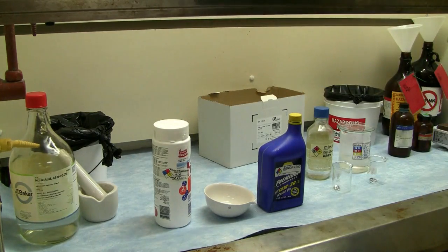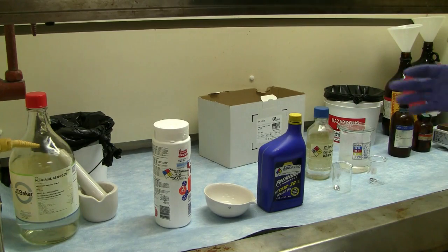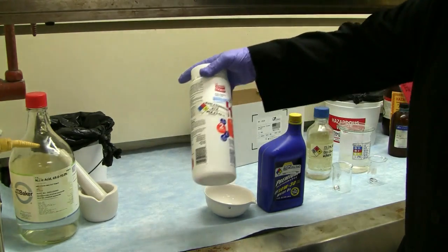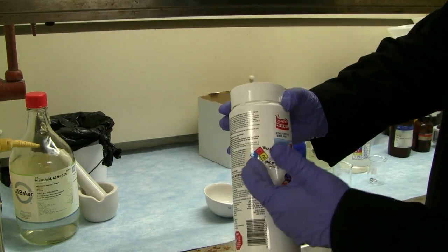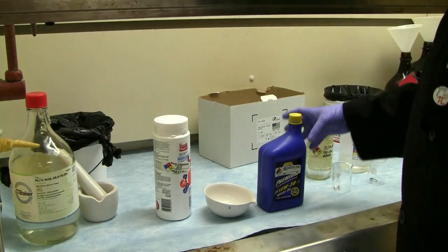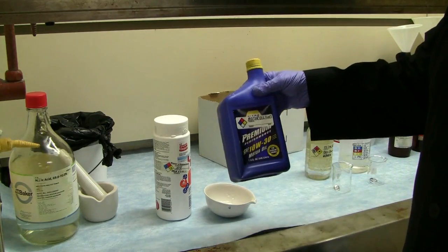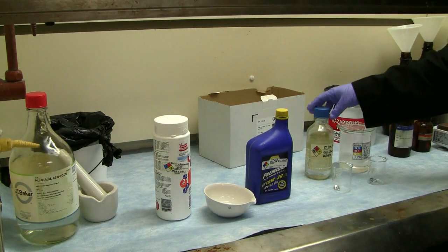And what we have here today is we're going to do a little bit of hazard chemistry demo. And we're going to look at incompatibles and reactives. In order to do that, we're going to look at trichloro-s-triazinetrione, aka pool shock or HTH. And of course we have our own chemical label on here, and we're also going to be dealing with motor oil as our hydrocarbon.